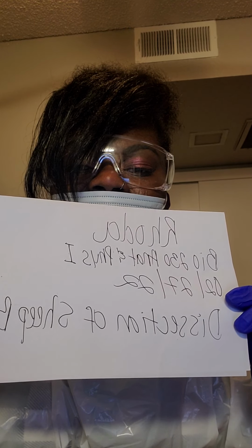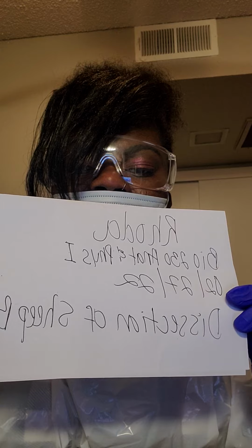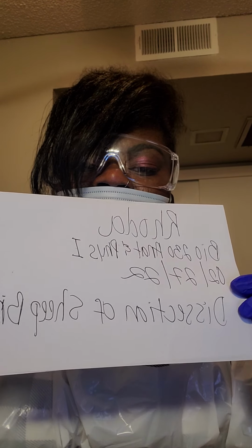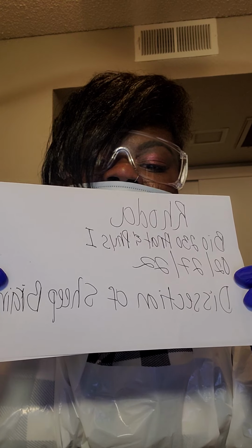Bio 230, Anatomy and Physiology 1. Date is February 27, 2022. Today I'll be dissecting a sheep brain.